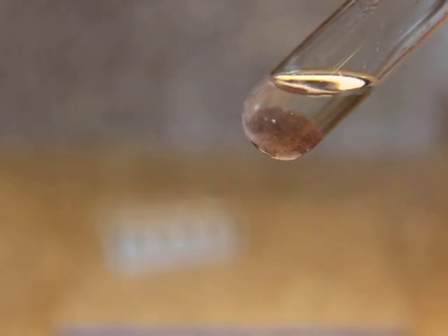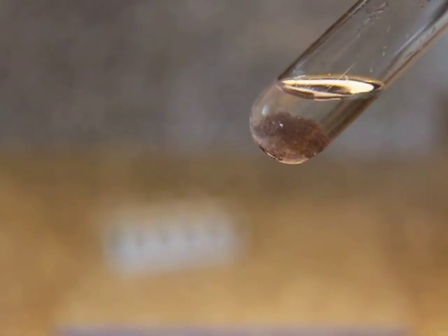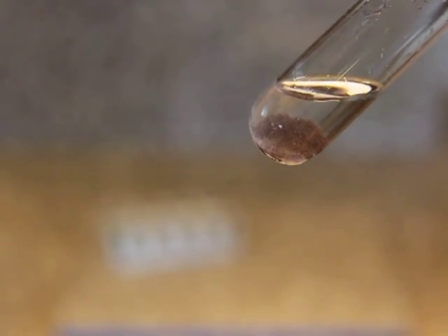If you take a look at the test tube's contents, you will notice that the iron filings have become covered with a red copper coating.